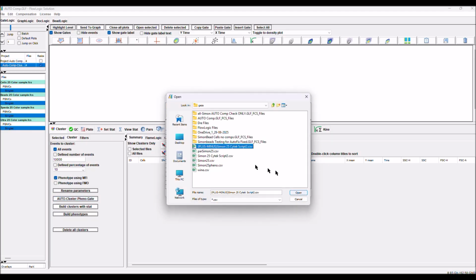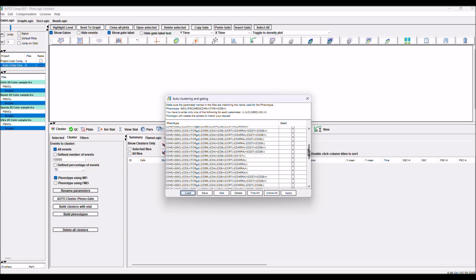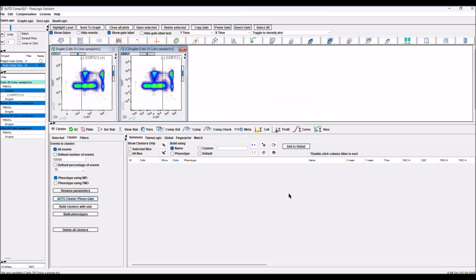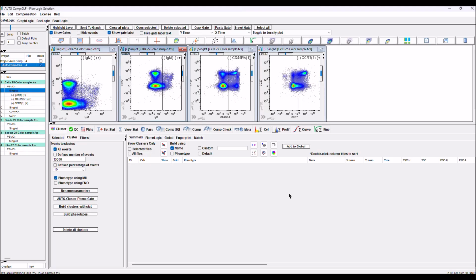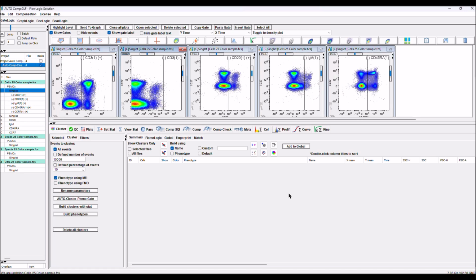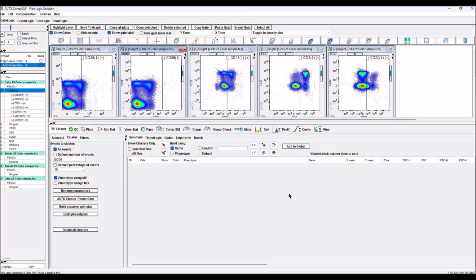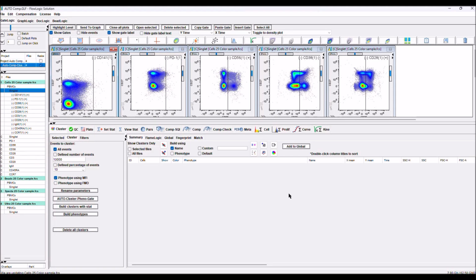Here we have positive and negative phenotypes. We get all of them. We have roughly 40 populations to extract. Tick all because we want to do all. Click apply, and FlowLogic is going through and will build for us, for each marker, one delineator splitter. So we split the data when we do the extraction from positive and negative. Now FlowLogic is going through the data.